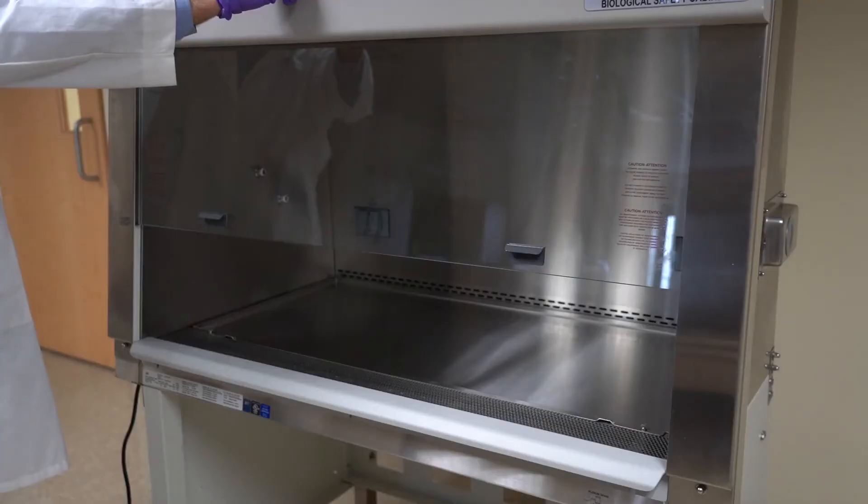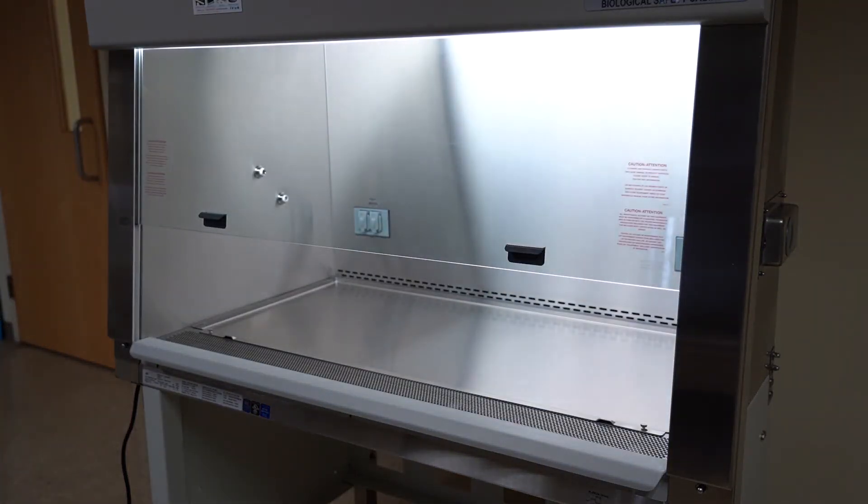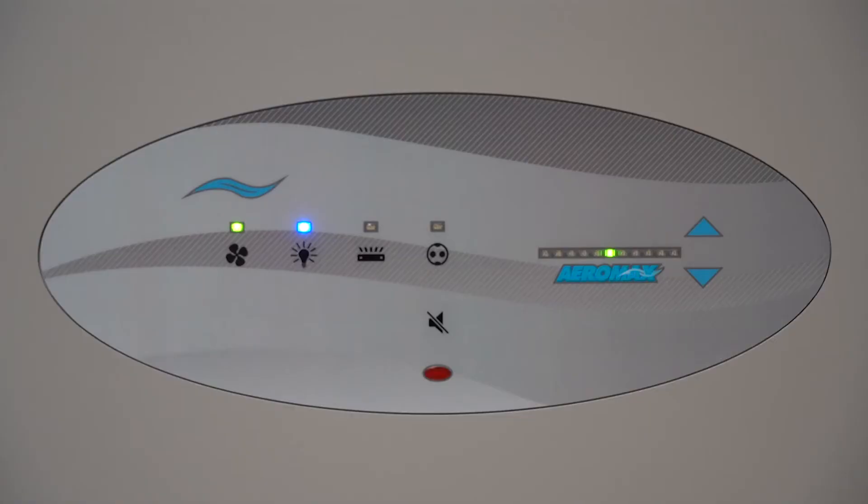Light up the work area. Turn on the outlet for devices plugged in inside the work zone.